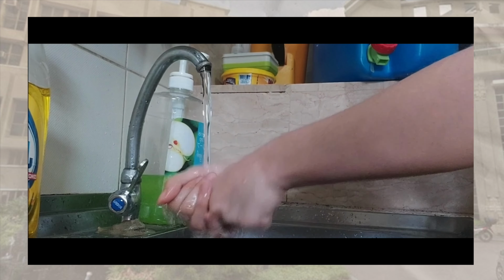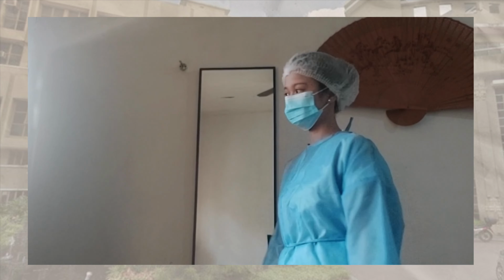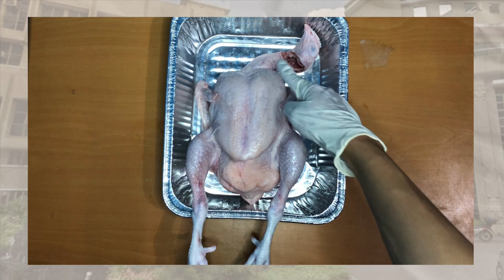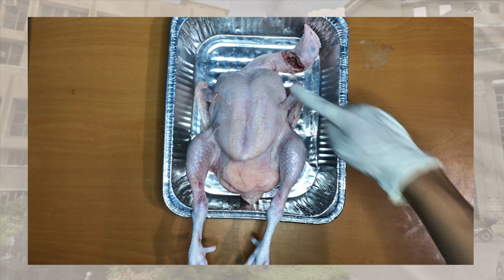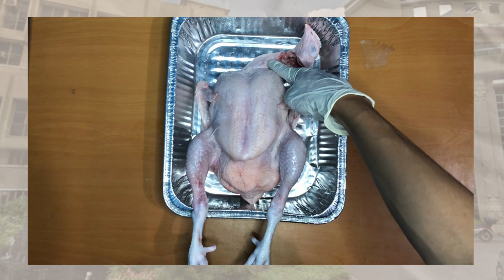The clinical pathologist gets ready by washing her hands and wearing the prescribed clothing inside the operating room. The doctor first examines the directional terms of the patient. Here are the left and right sides of the body. Superior is toward the head end. For example, the eyes are superior to the neck.